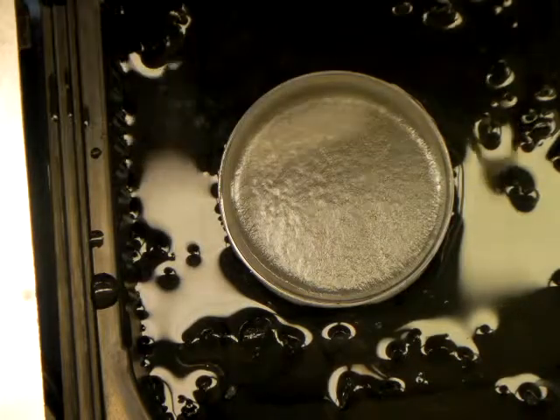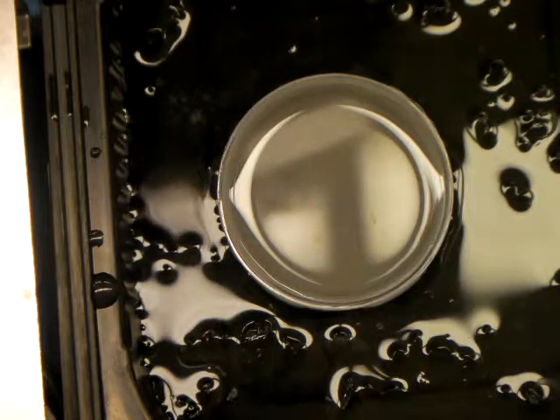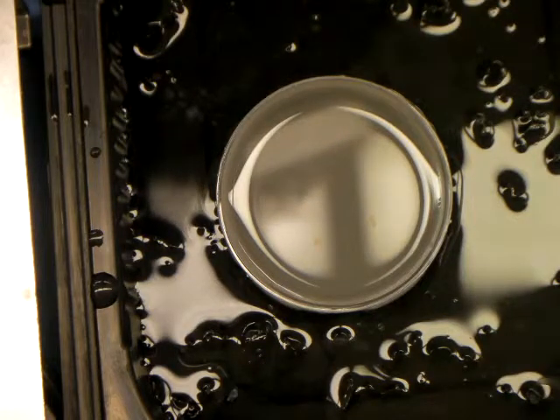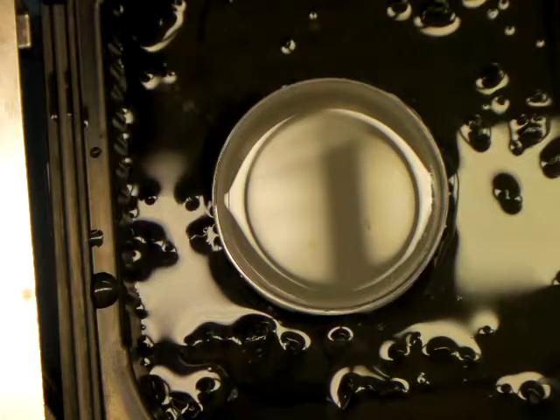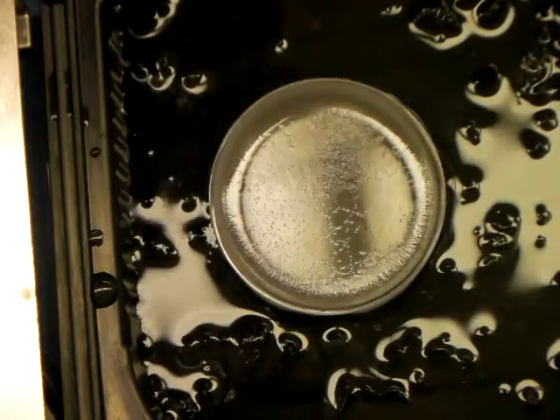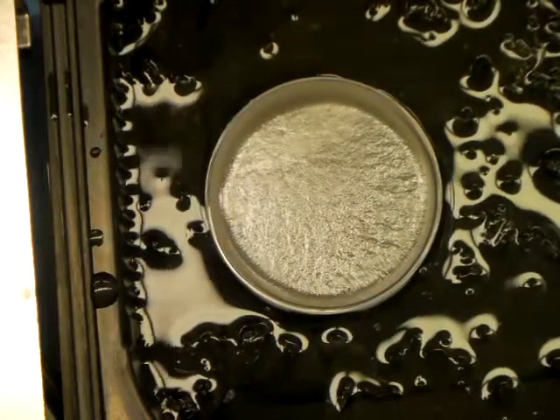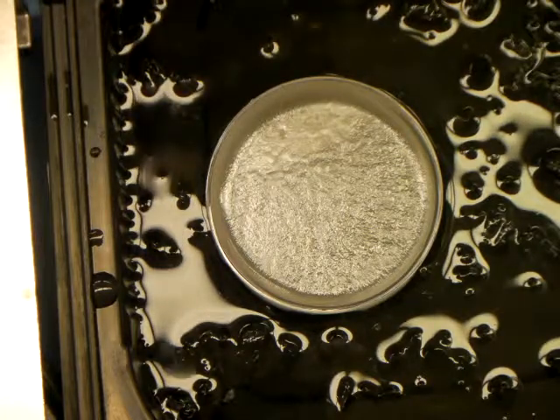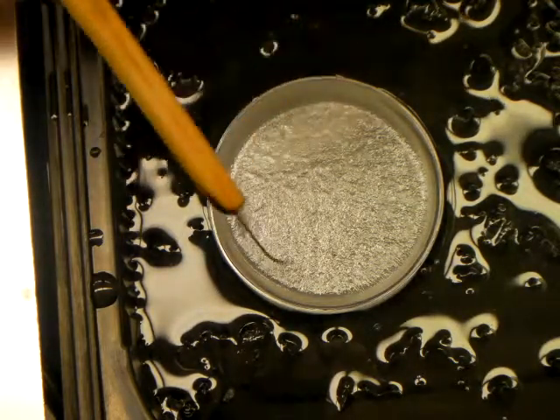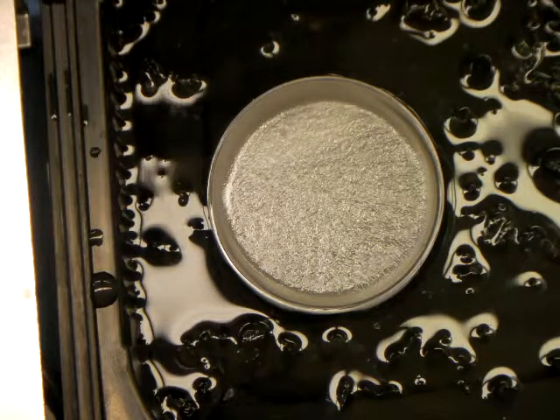That's going to cool on the top — I'll flash it once to make sure it cools from the bottom up. If you need to add ice along the way as some of it begins to melt, having your ice bucket handy is indispensable. Make sure you don't splash water into the paraffin while it's still in its liquid state — that's very important. You can see the paraffin is starting to develop a little bit of a skin on top. I'm going to wait until that's more or less completely solid, then we'll dunk it to finish the cooling process.